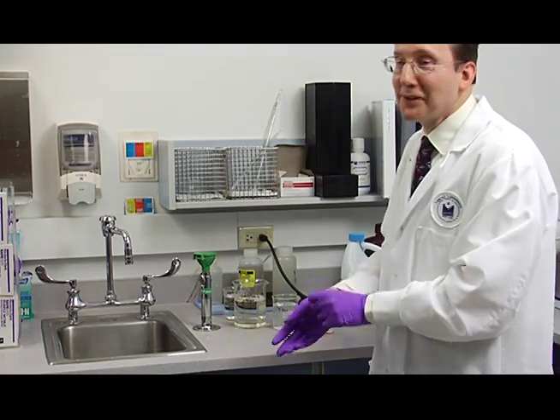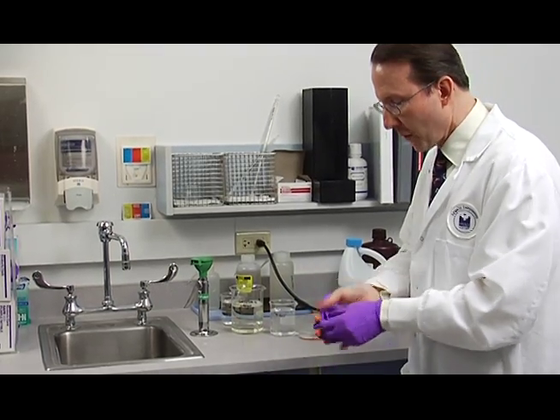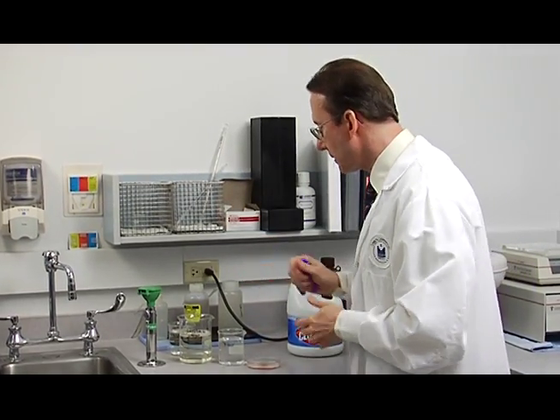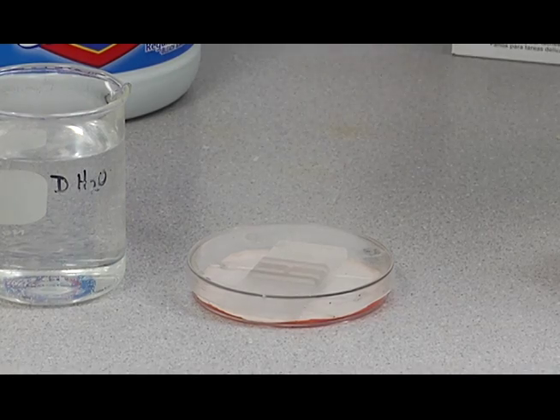Now you need to take your gloves off. Most gloves will leave a sticky film on your hemocytometer and layer on top of your liquid. So you want to take them off at this point.